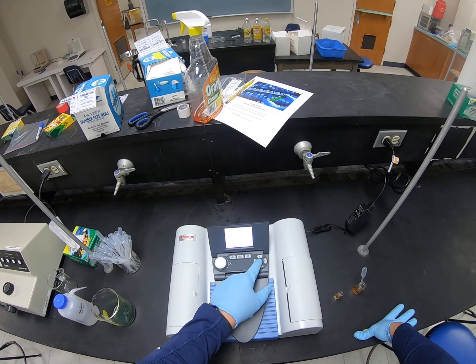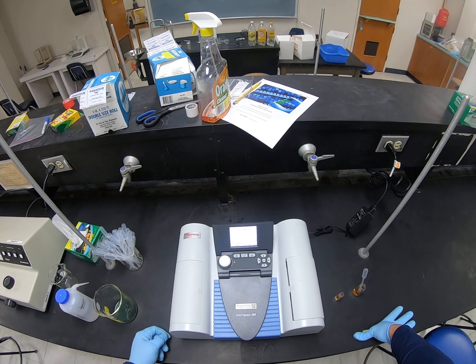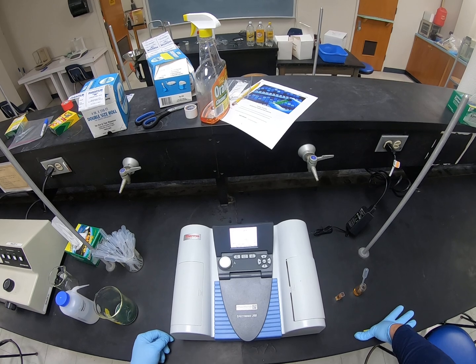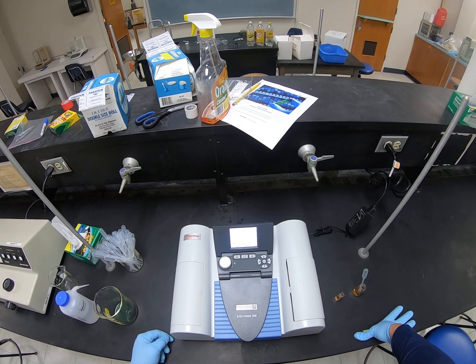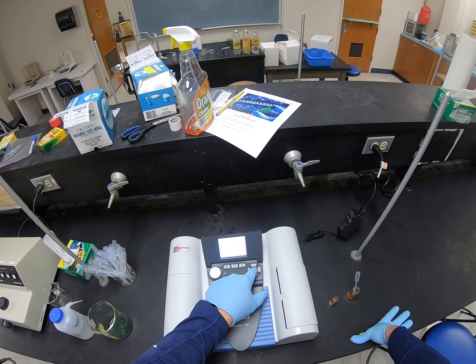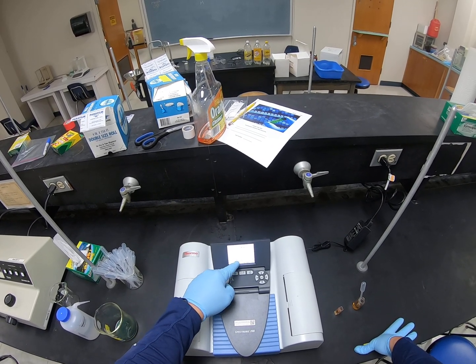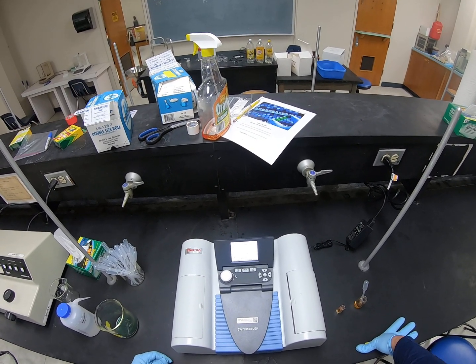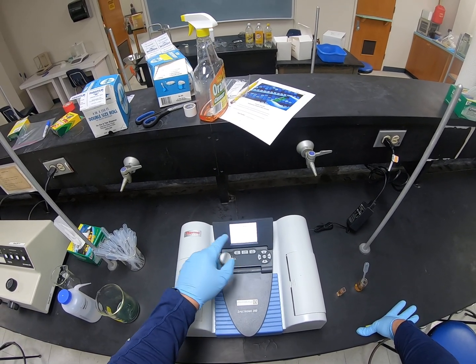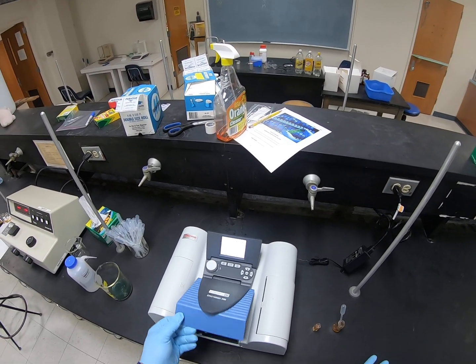And scan and enter. I'm going to hit 0, let it auto 0 with just the water in it. Forgot to 0 it first. And now I'm going to go to the enter to scan. What I should see is that the value for just the water should be right at 0. And we can barely see some little red dots in here. So it's right at 0 from 400 all the way up to 900 nanometers.